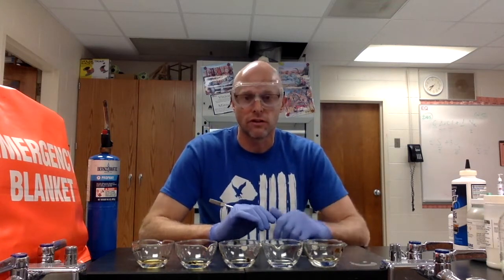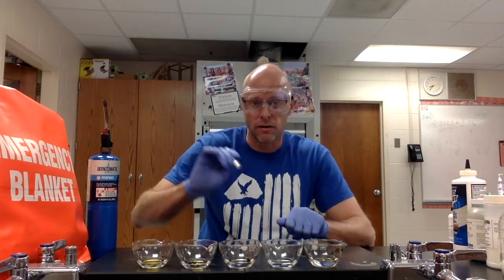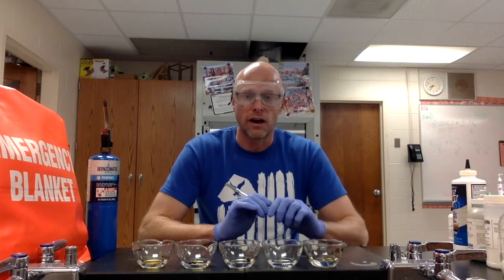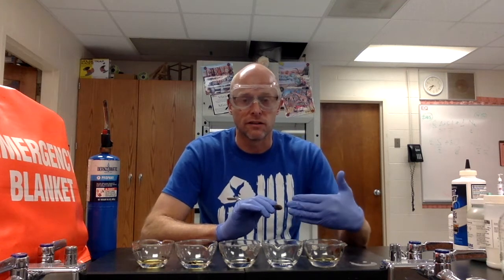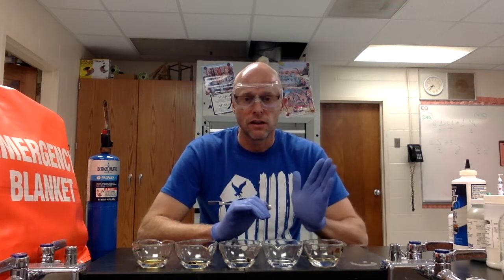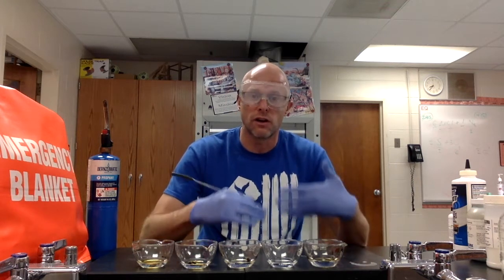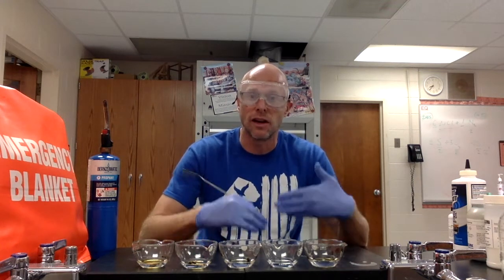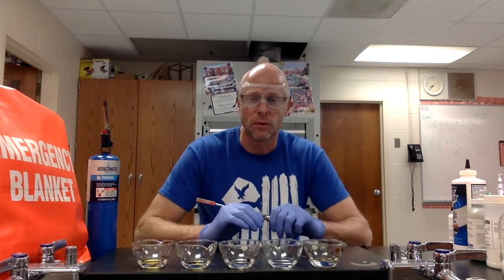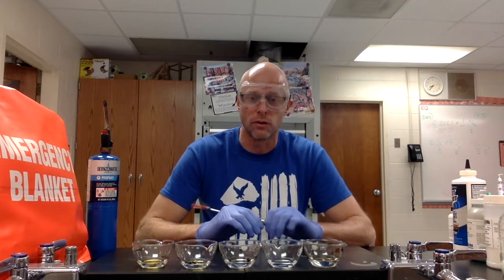Methanol is also poisonous, that's why I've got gloves. What I'm going to do is put different compounds into each of these evaporating basins, then we're going to set them on fire and see different colors coming from each compound. The reason for that is each compound has a particular metal in it, and each metal has a different electron structure, indicated by different colors because electrons are being excited from the energy from the fire as the methanol burns.